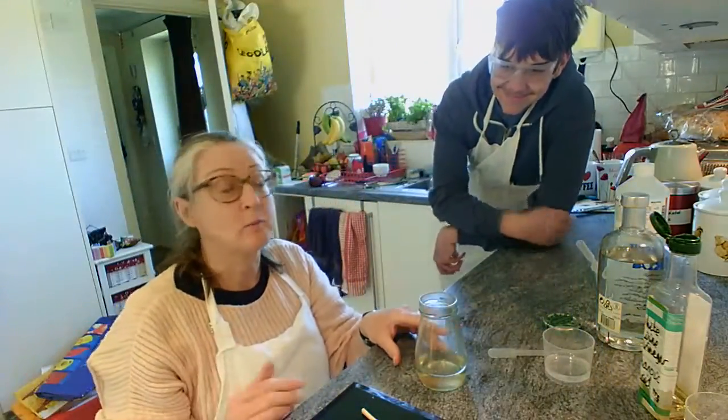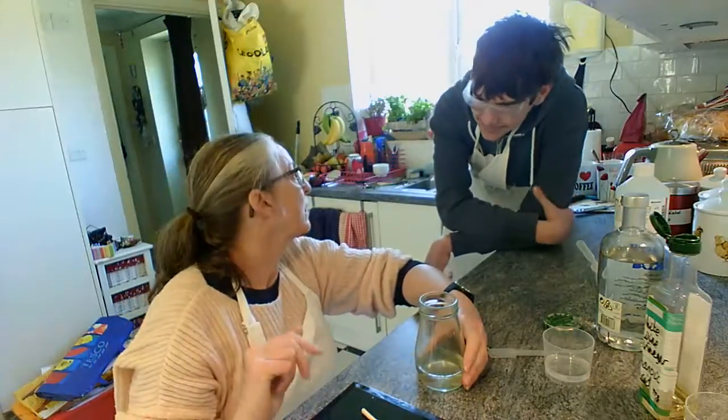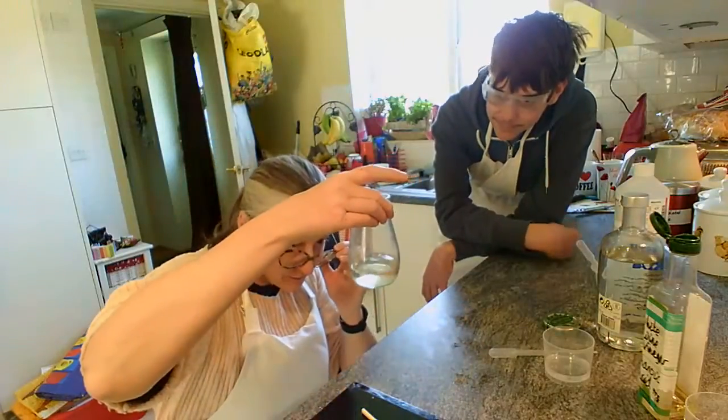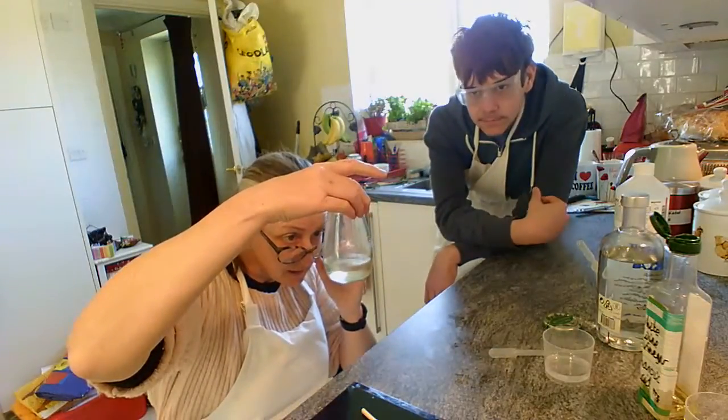We have got the door open, by the way. So yeah, I've just turned the cooker on and off with my elbow. We have got the door open, and a window is partially open at the other end to give us plenty of ventilation, because obviously it's all about the ventilation these days.